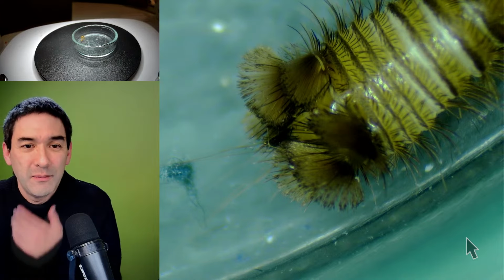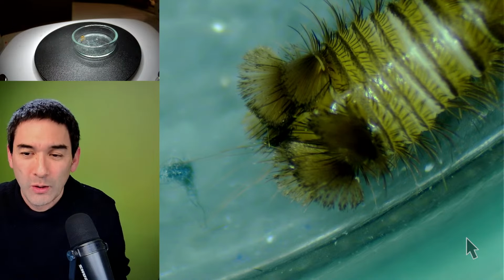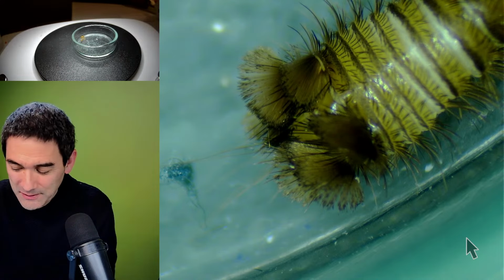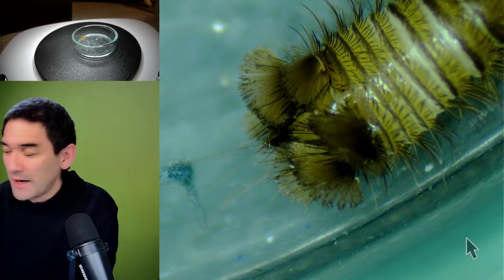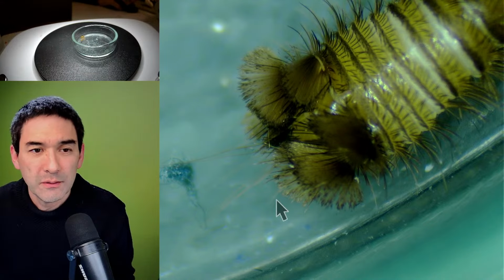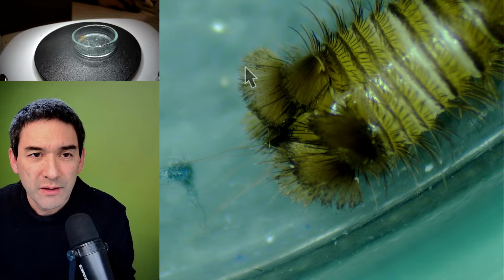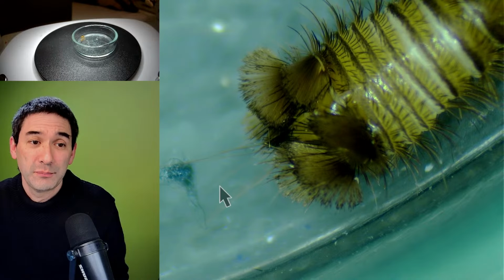I just had this little carpet beetle crawling around on my wall. Maybe it's going to pull it back again in a minute or so. I'm going to leave the carpet beetle alone now. Here on the back side, you're barely visible, these things seem to be individual extensions, like arrows, here on the back.